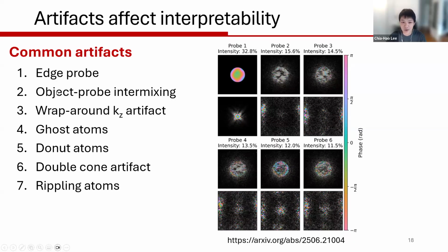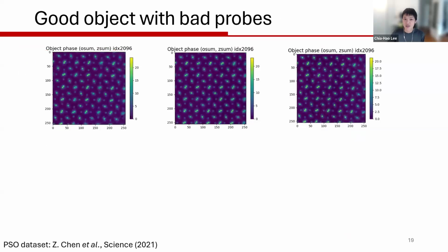And actually, there are a lot more artifacts coming in. I'm going to touch on a couple of these. Some of them are package or constraint dependent. Some of them are more dataset dependent. But the rule of thumb here is you want to pay very close attention to your reconstruction, not just your object, but also your probe and your position. I'm going to give you some examples of where to look and how we may possibly correct them, if I happen to know the answer. So here comes the very first example. I'm just going to give you a couple of seconds to look at all these three reconstructions.